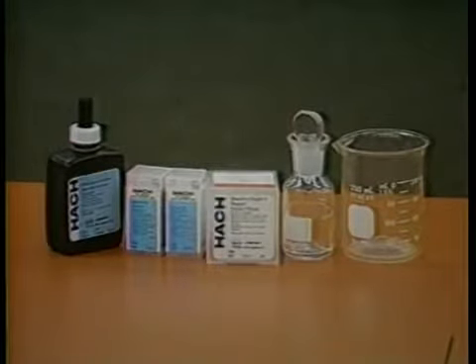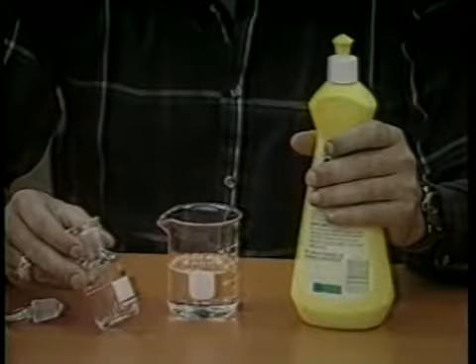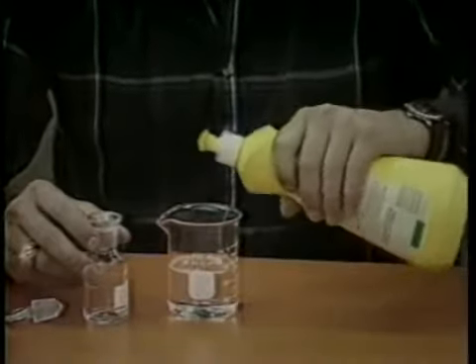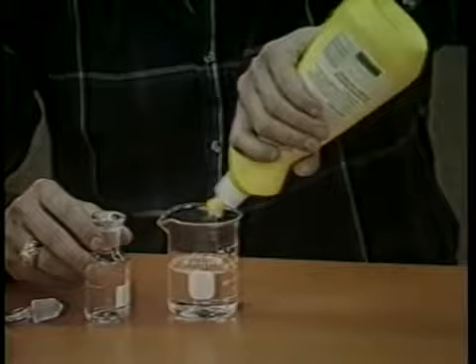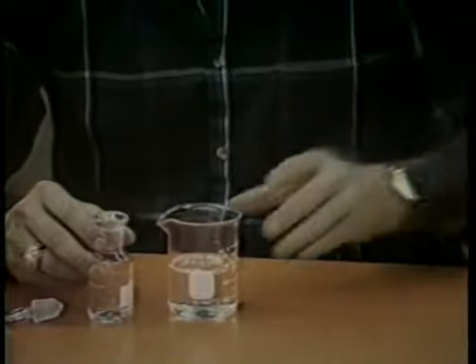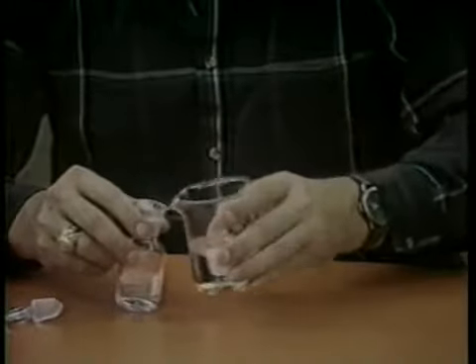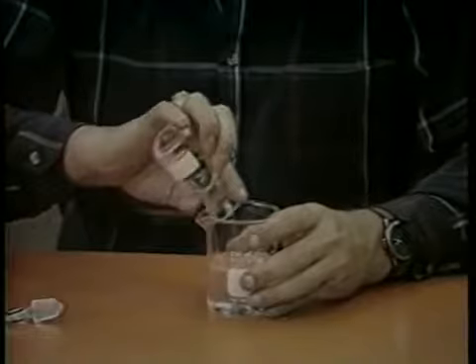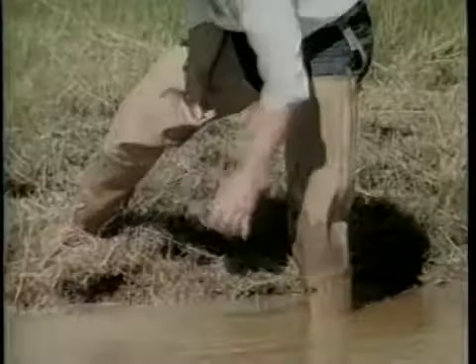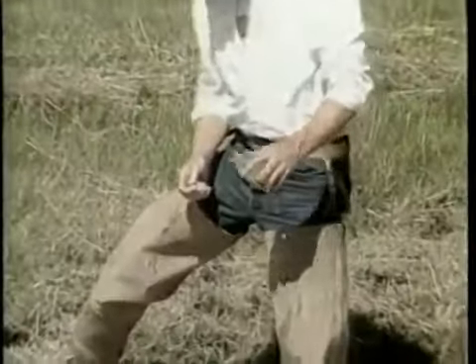To measure dissolved oxygen using the water quality test kit, proceed as follows for the high-range test. Obtain a water sample from the pond by using the glass-stoppered dissolved oxygen bottle provided with the kit. The bottle should be cleaned before and after each use. To clean the sample bottle, use dishwashing detergent, making sure that it is rinsed well with clean water, preferably distilled or tap water. The sample should be taken away from the pond bank to avoid vegetation.